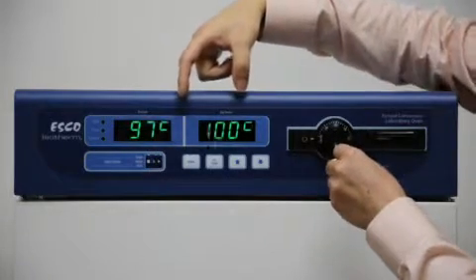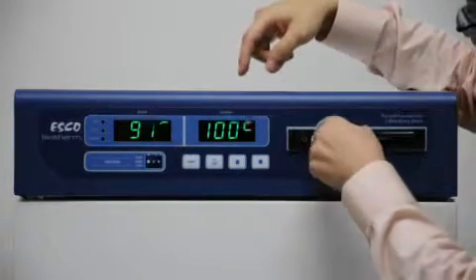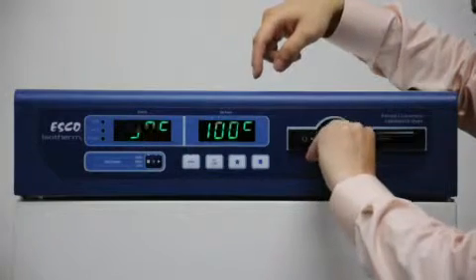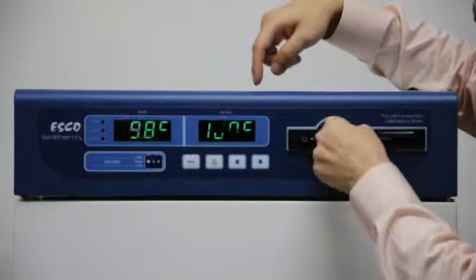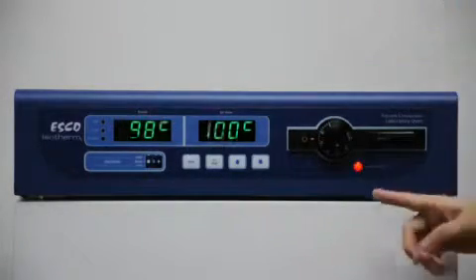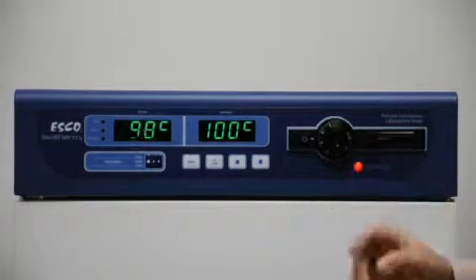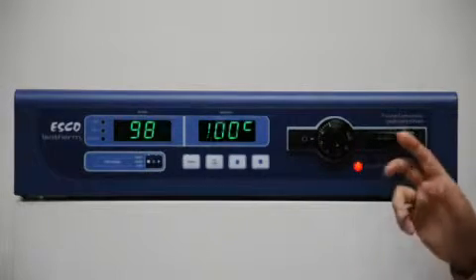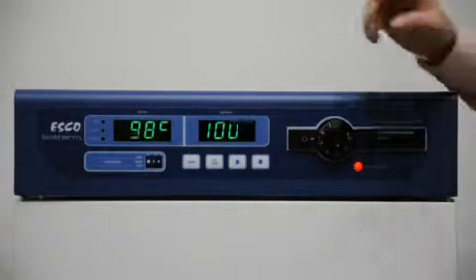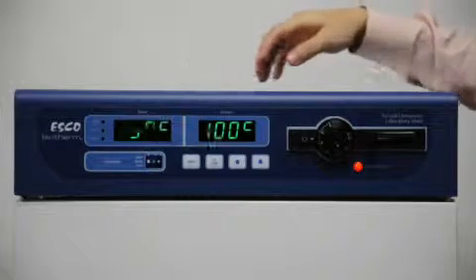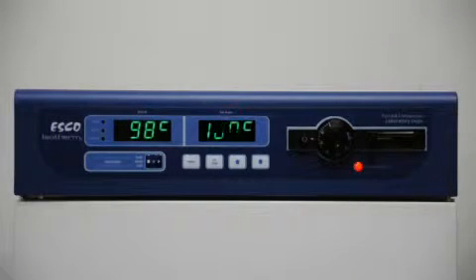The device is now running at about 100, so if I just turn it down this way with a coin, notice the over temperature pilot light lights, and at this point in time the heaters are cut off. This is an independent action, isolated from the microprocessor control, which provides a measure of safety.